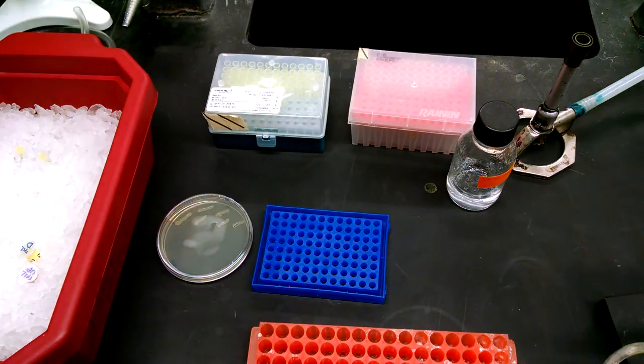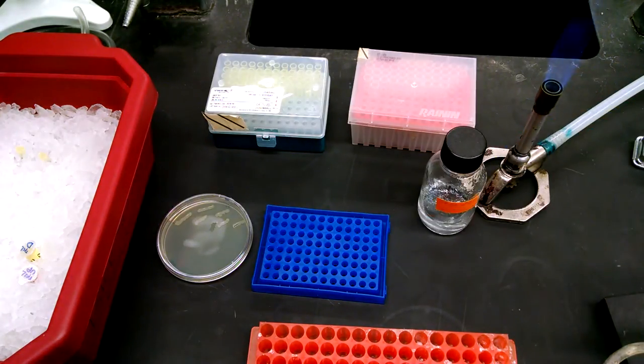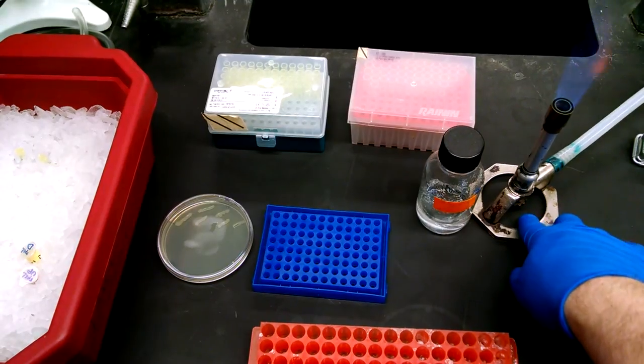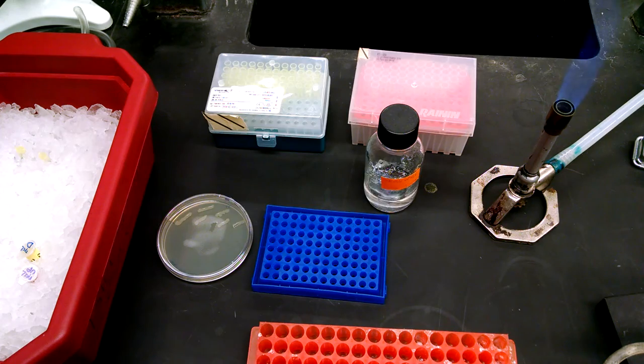We want to do everything aseptically, so let's get a flame going. There we go. And so we need to make our template DNA, and that's what we're going to use those colonies for.